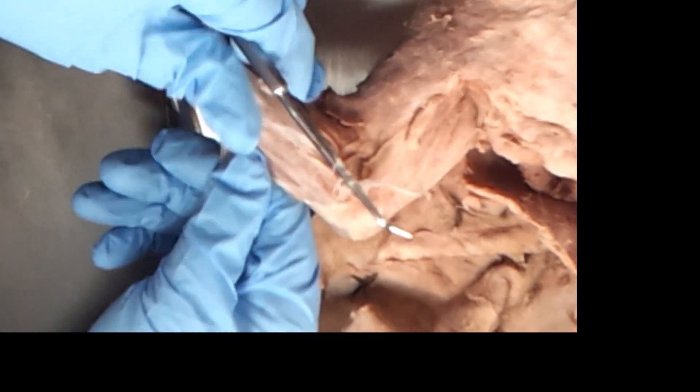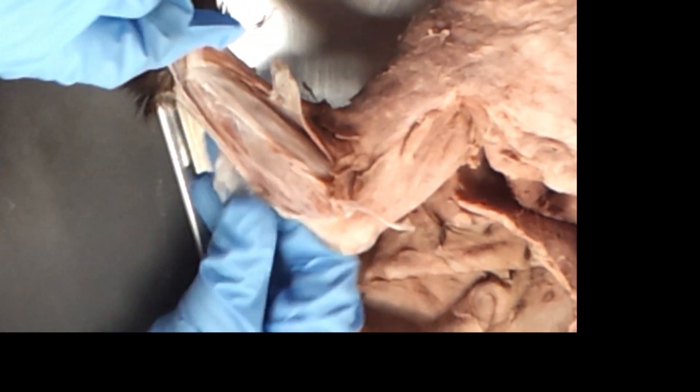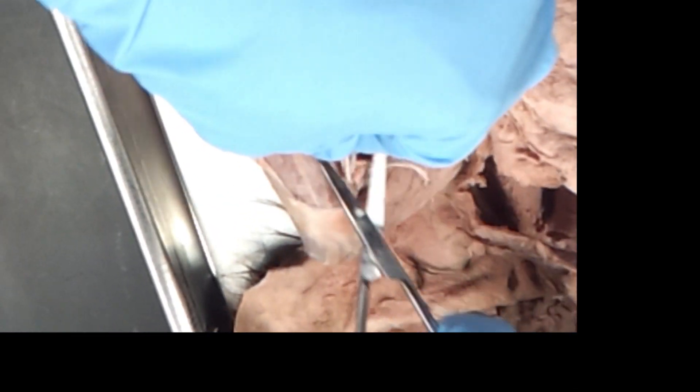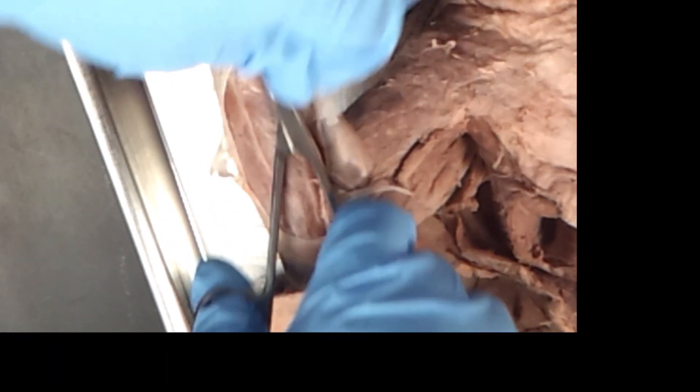I still kind of like jerky. I love jerky — jerky anytime is fine. But you can get rid of this. If you don't want to look at all this fascia, just grab a pair of scissors and you can trim it off, because it's not going to tear very easily. You can see how thick that is — it's pretty thick.